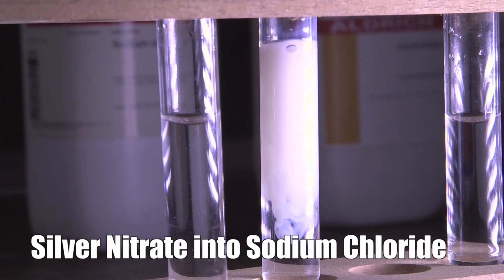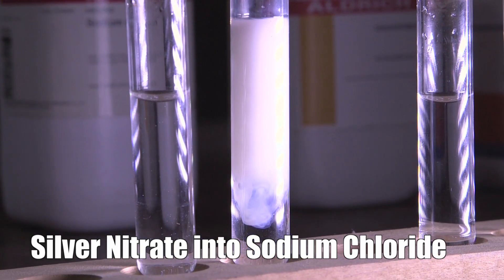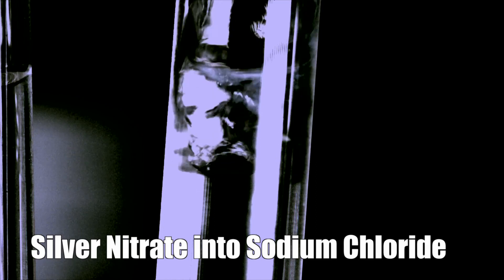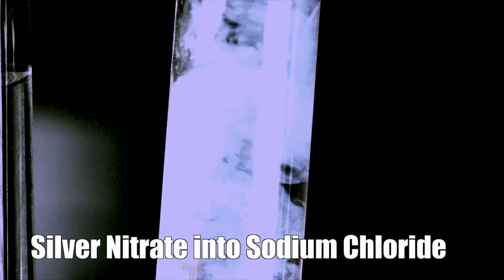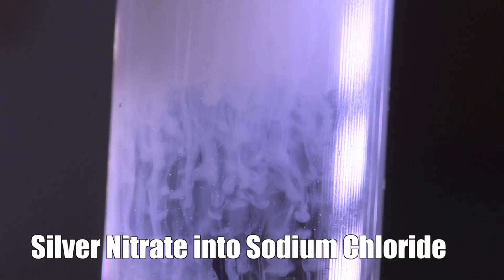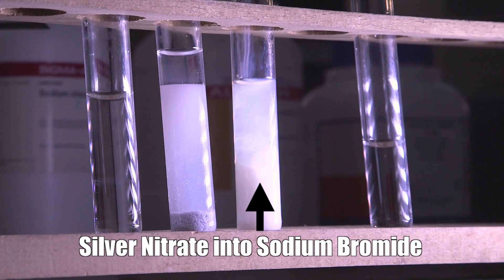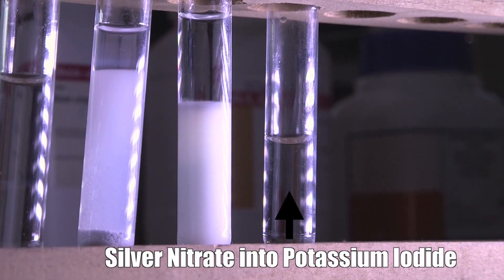With silver chloride you get a fairly white precipitate. These precipitation reactions take place incredibly fast — much faster than your eye can follow. This is not something that gradually develops: one minute it's clear, the next minute, boom! Silver bromide is pale yellow, and silver iodide is rather more yellow.